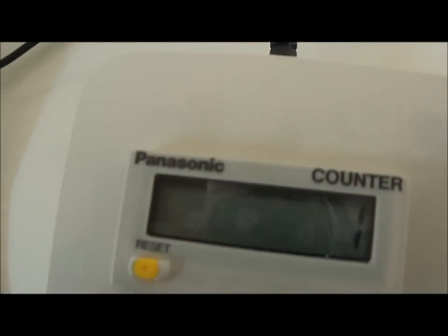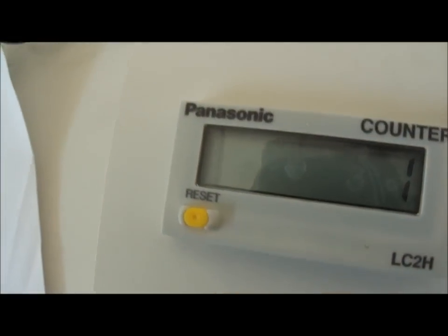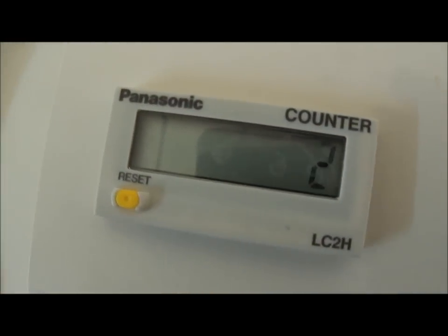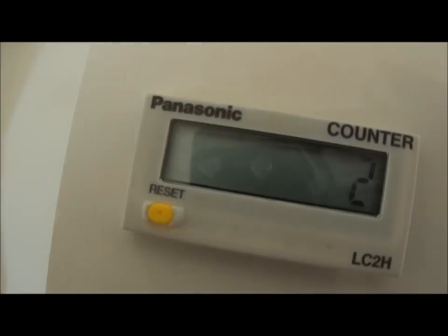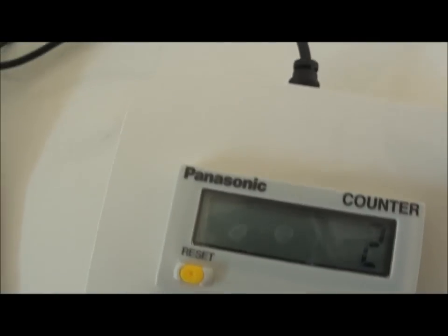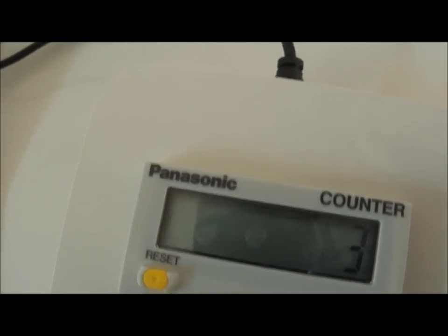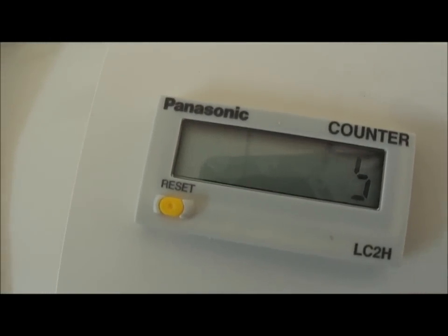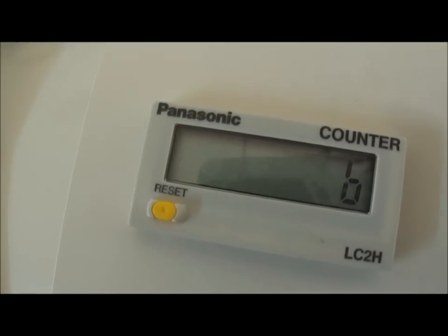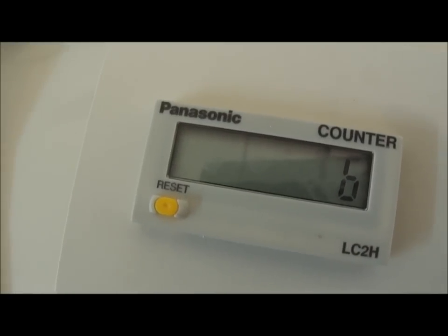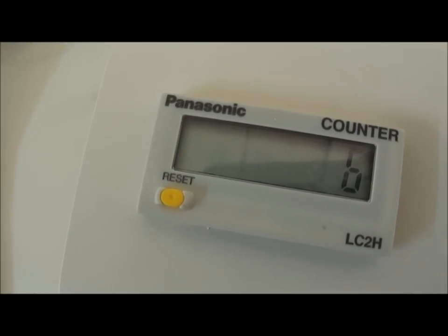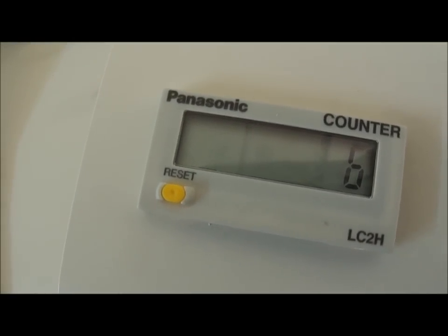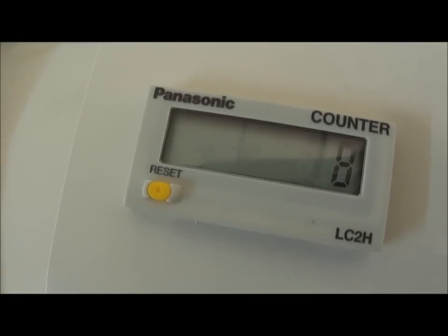The counter is marking one, if I press again, two, and then you have three, and then you come this way, and it will record directly the number of colonies you are counting.